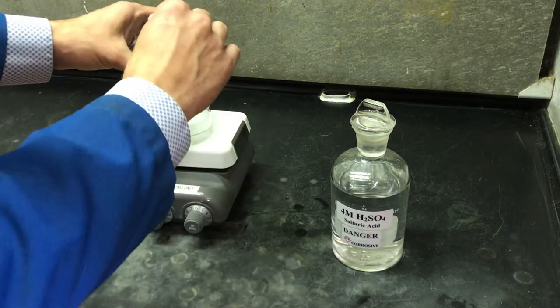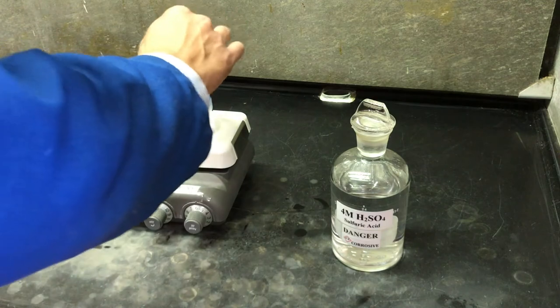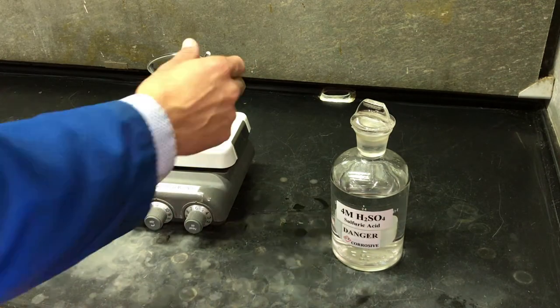We will now heat this solution until it's completely dissolved. We will avoid boiling our solution.